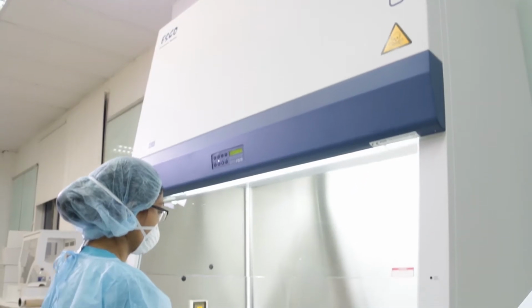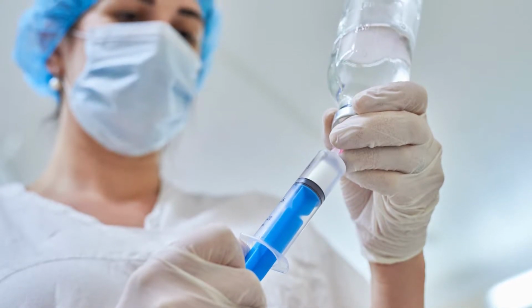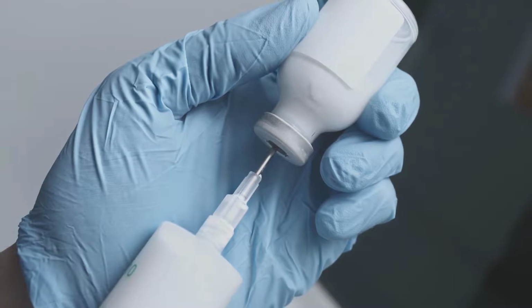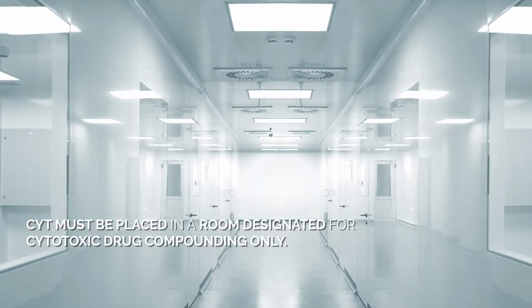The CYT is not a magic box, therefore aseptic technique is still necessary for protecting the product and the operator from the risk of contamination. The CYT must be used only for handling and compounding cytotoxic drugs. CYT must also be placed in a room designated for this purpose only.